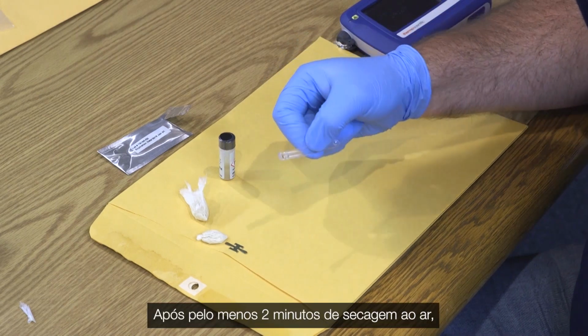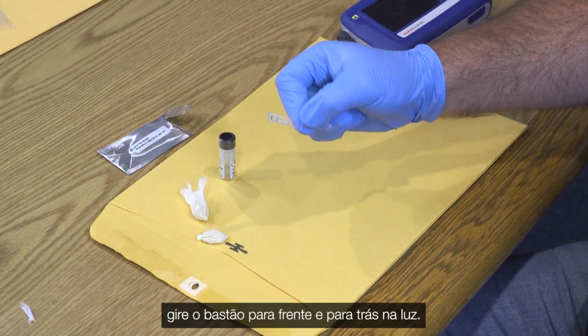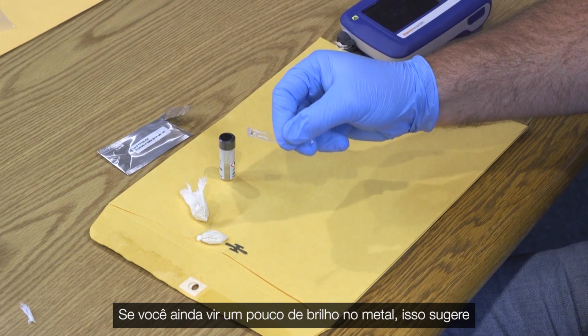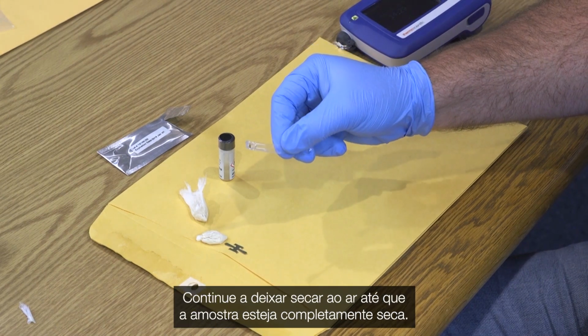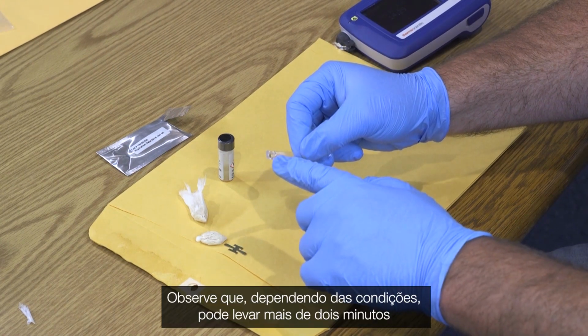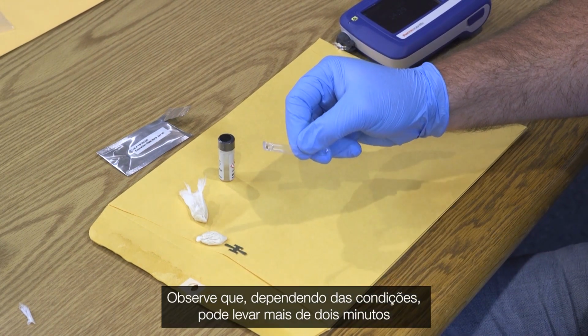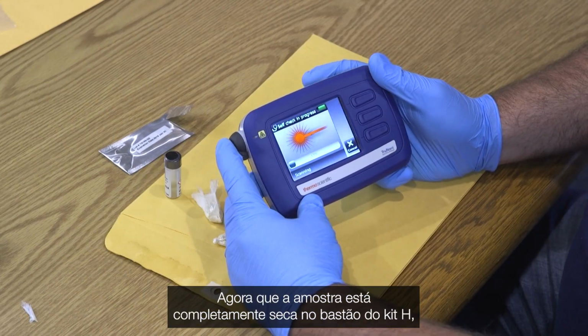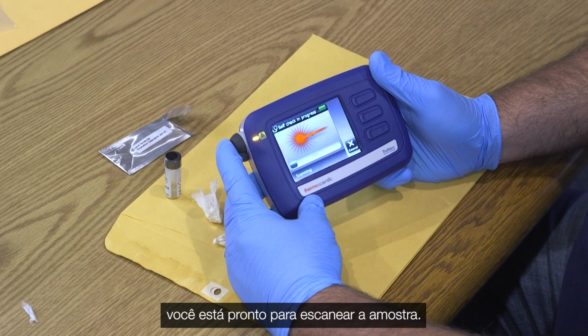After at least 2 minutes of air drying, turn the stick back and forth in the light. If you still see a little sheen on the metal, that would suggest it is still wet. Continue to let it air dry until the sample is completely dry. Note, depending on the conditions, it may take longer than 2 minutes for the stick to dry. Now that the sample is completely dry on the H-kit stick, you are ready to scan the sample.